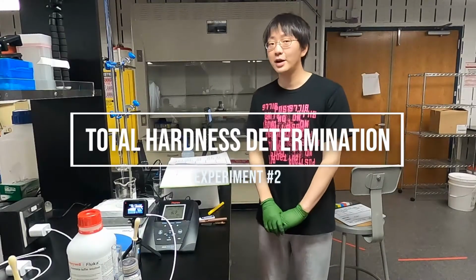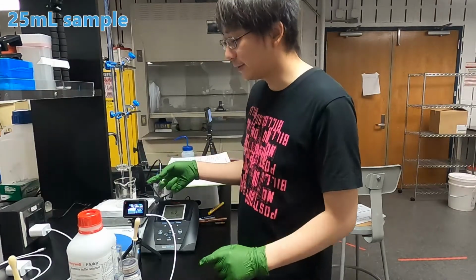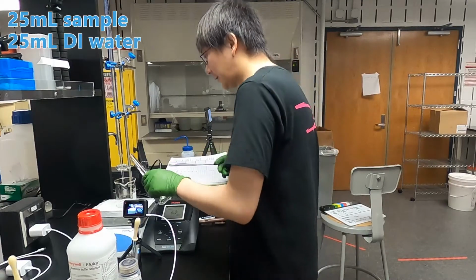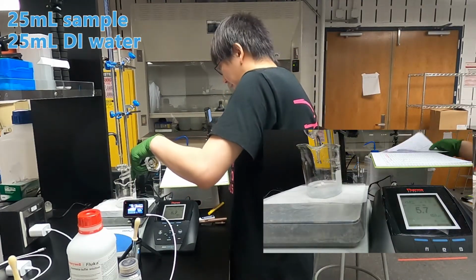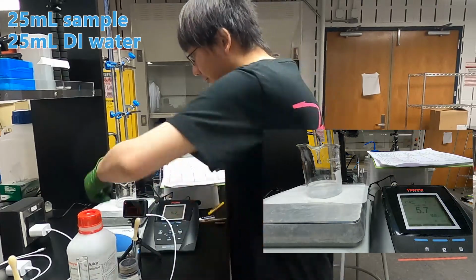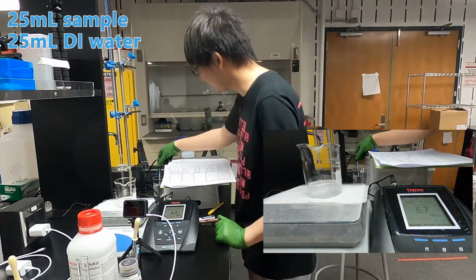So now we are going to measure the total hardness. So here is our sample. First we add 25 ml of DI water into the solution. And then we measure the pH of this solution.